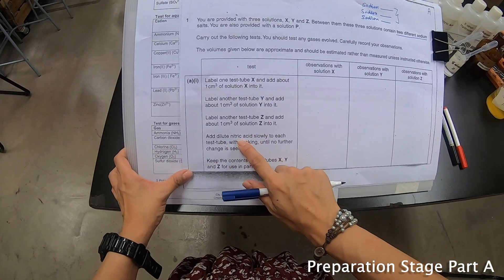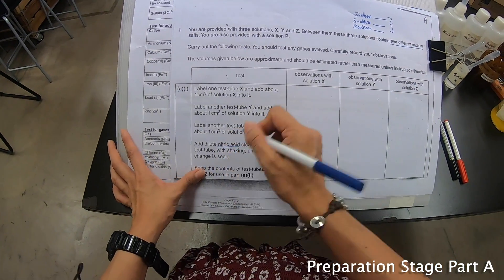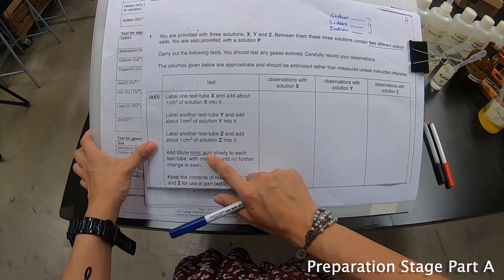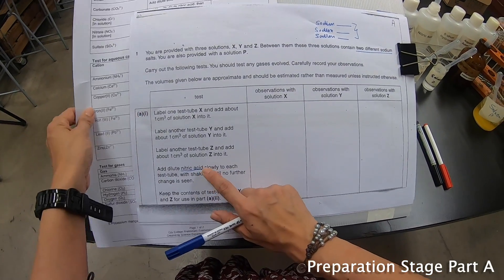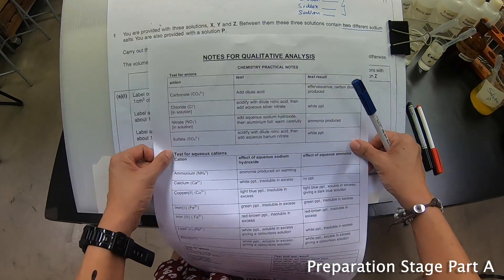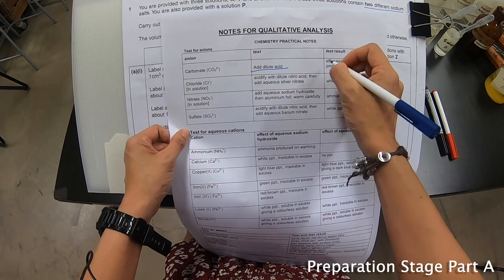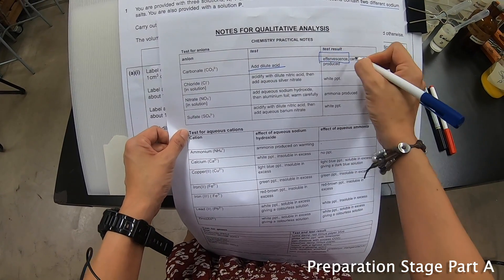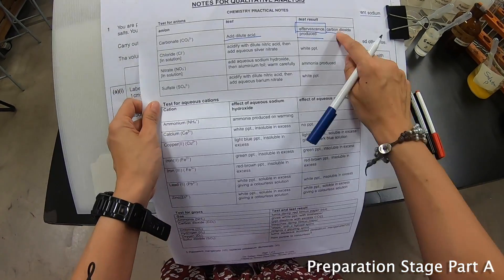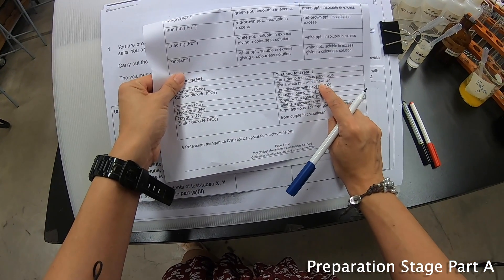Add dilute acid slowly to each test tube. This is the part to take note of — they say add dilute nitric acid. Every time when dilute acid or any acid is added, the qualitative analysis notes tell you exactly what we are testing. Add acid — usually we'll see effervescence, and if there's carbon dioxide produced, it shows that carbonate is present. To test for carbon dioxide, we use lime water.